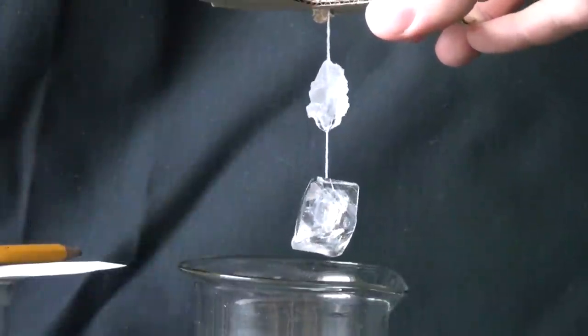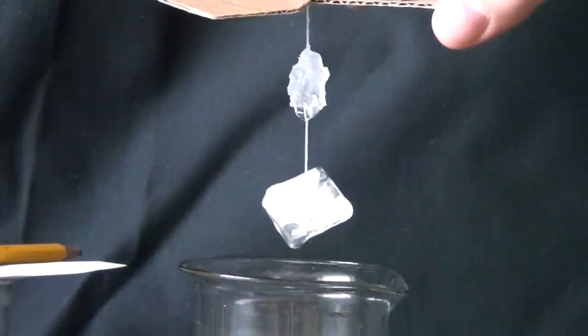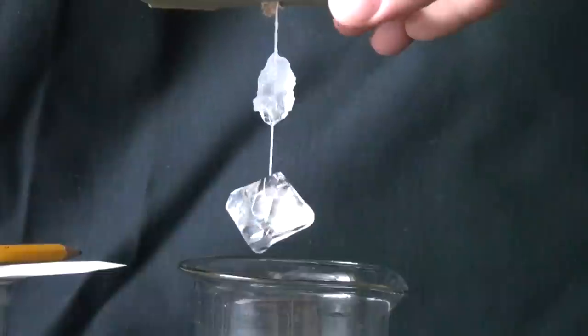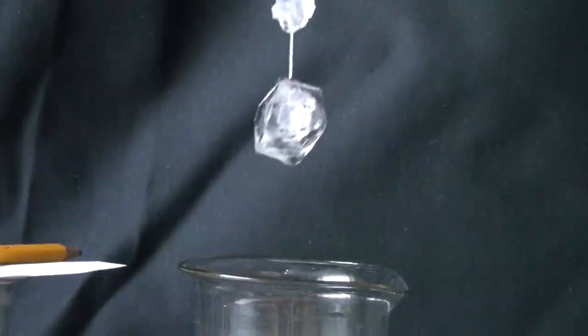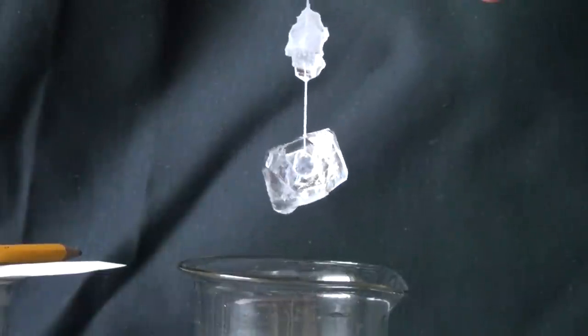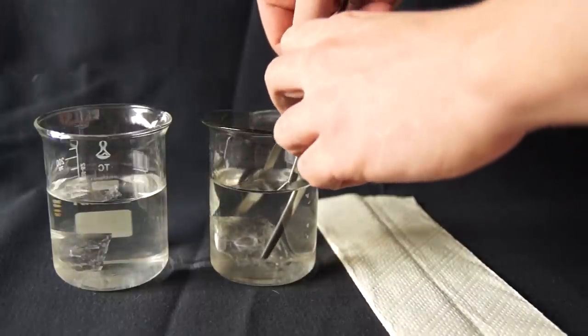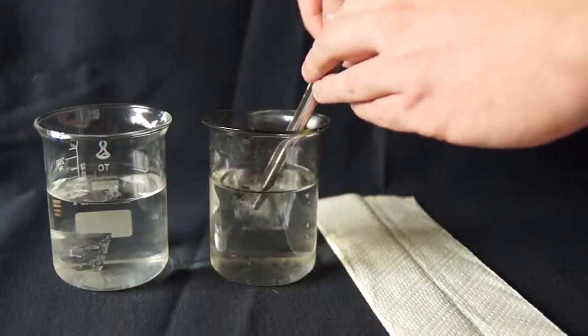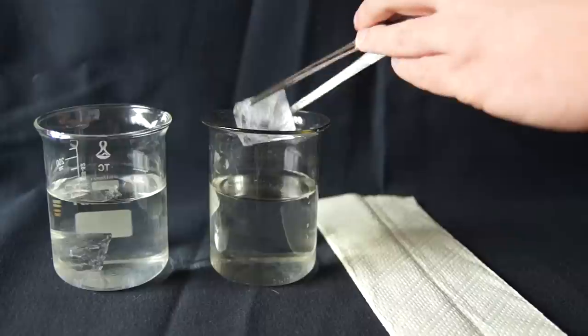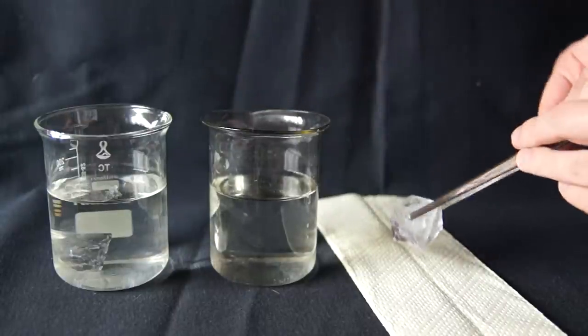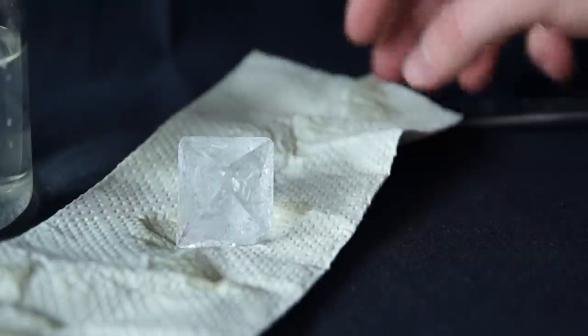Over time, my crystals from potassium alum become bigger. As you can see, they have acquired a very interesting form. And now, after about three months, I have grown two beautiful crystals of potassium alum. They are not perfect and not entirely smooth, but I still got the single crystal structure.